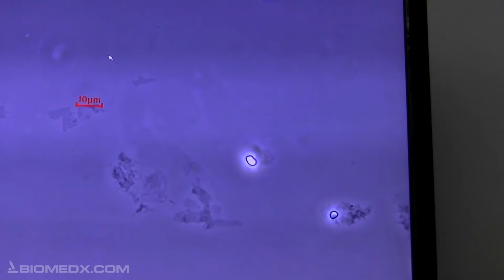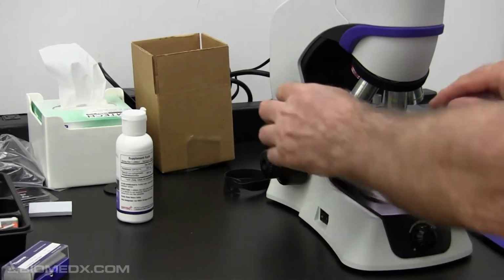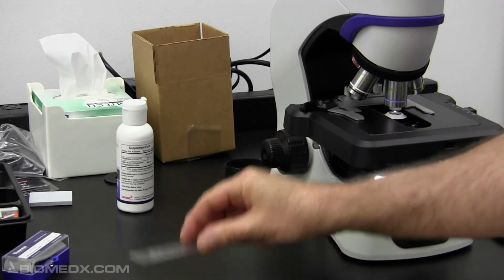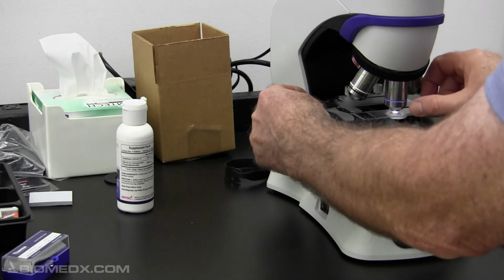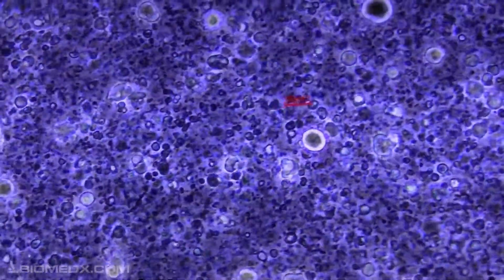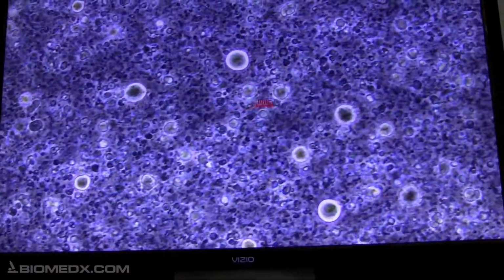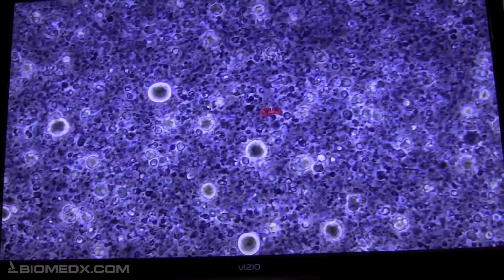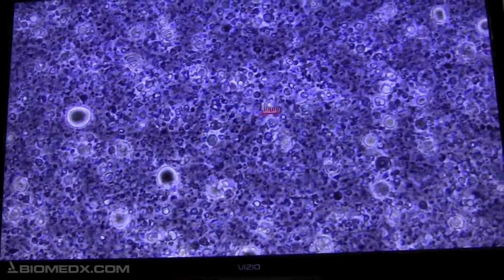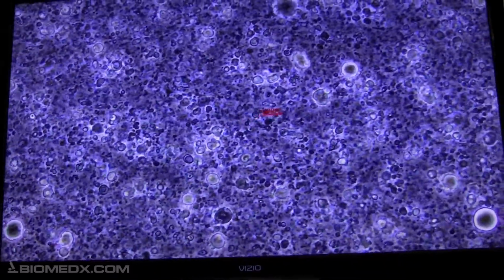So what we'll do now is take that product. I'll take your product off. This is the product. I'll put that product up. And focus. And now we'll look at the monitor. Let me just back out a little bit. So that was a thick sample. A lot of material here. And it's moving pretty well. I could have flattened that out a little bit. But let's zoom in.